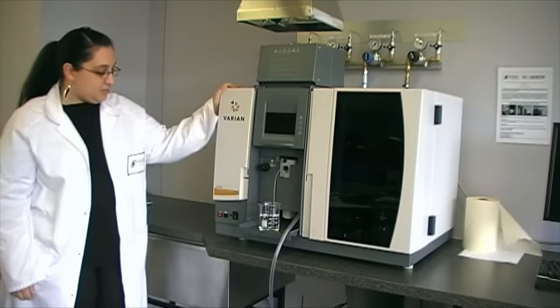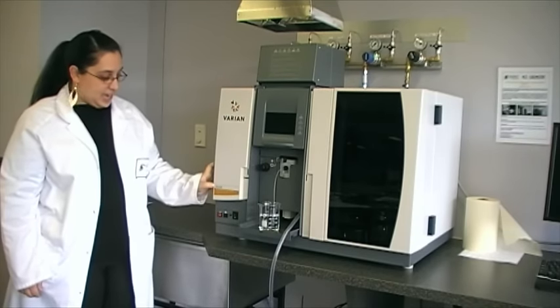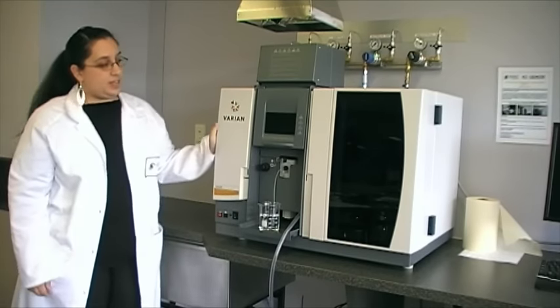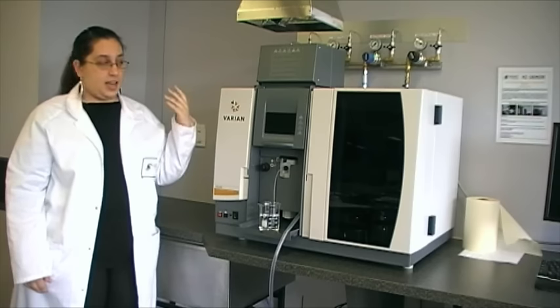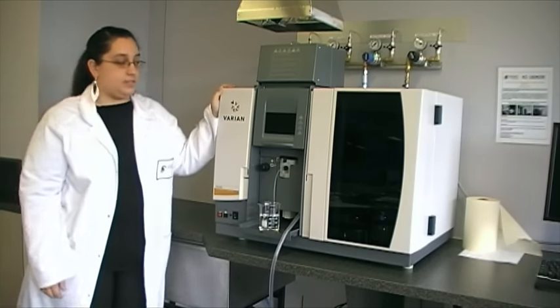Hi, my name is Catherine and I'm going to be taking you through the Atomic Absorption Spectrometer. This instrument is provided by Varian and its model is an AA240. So we're going to have a look at how we can actually atomise a sample and then see its absorbance.